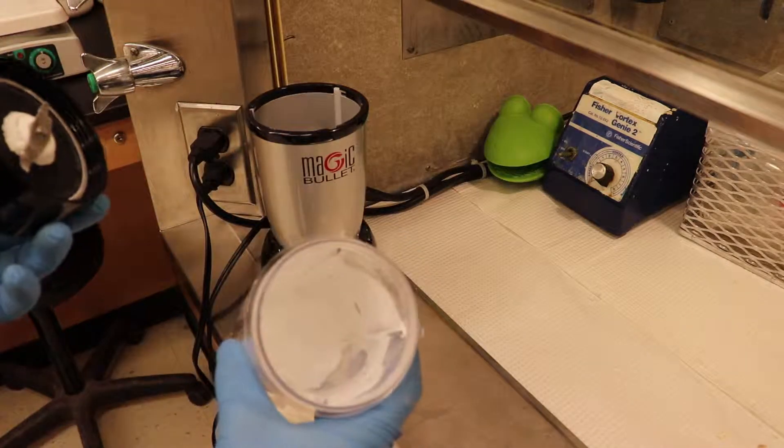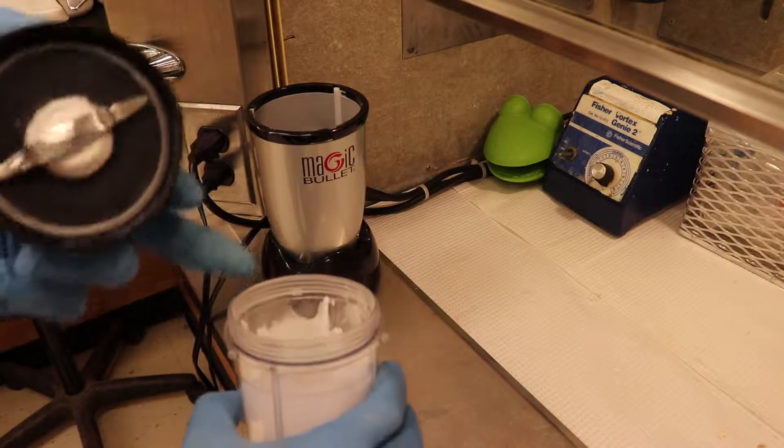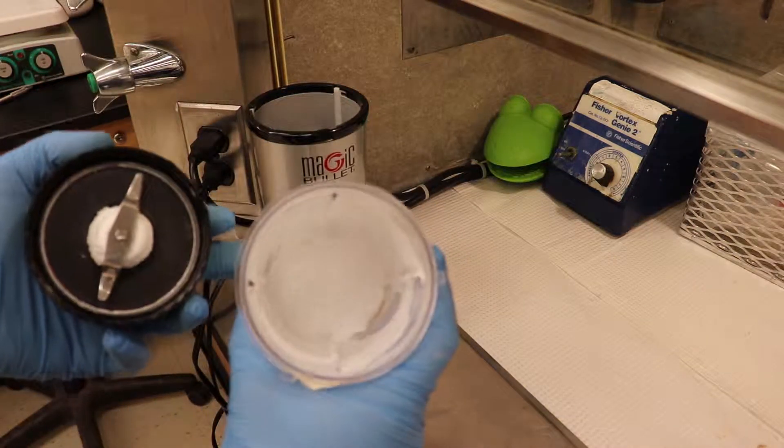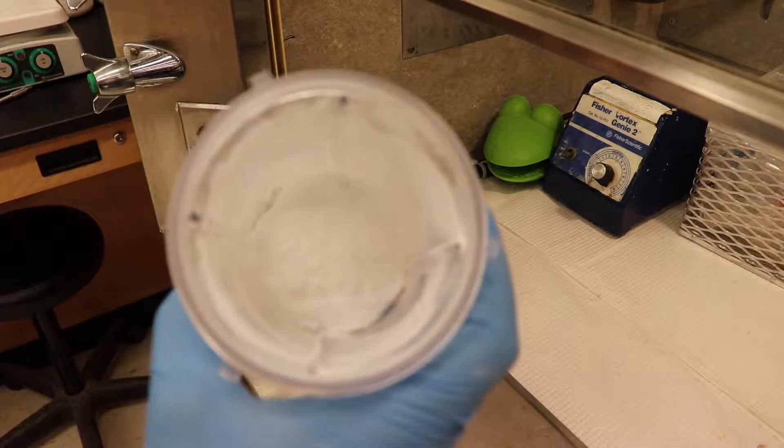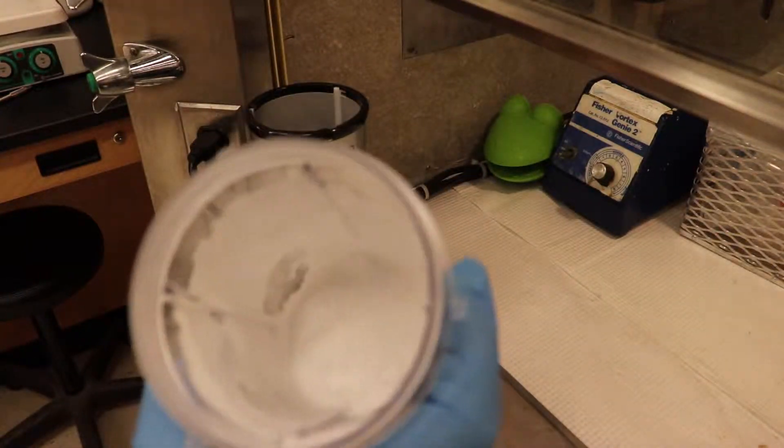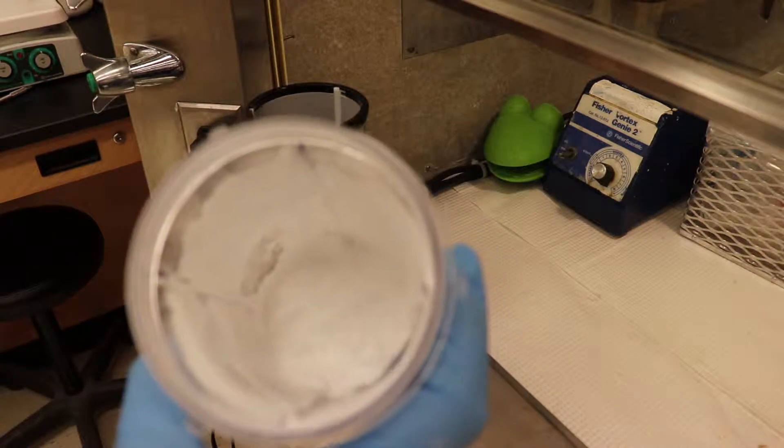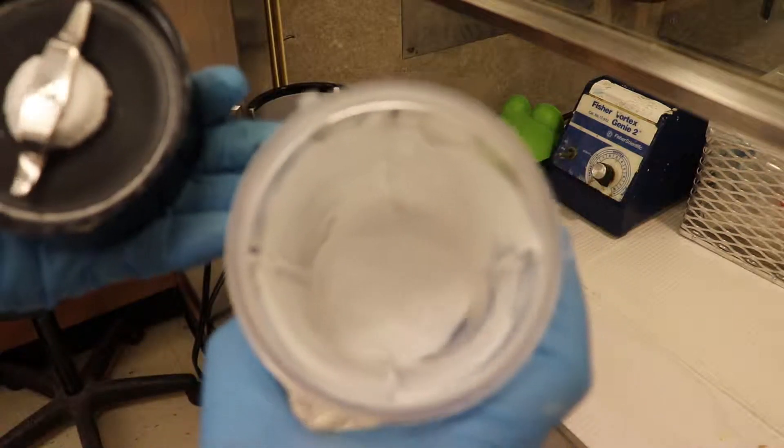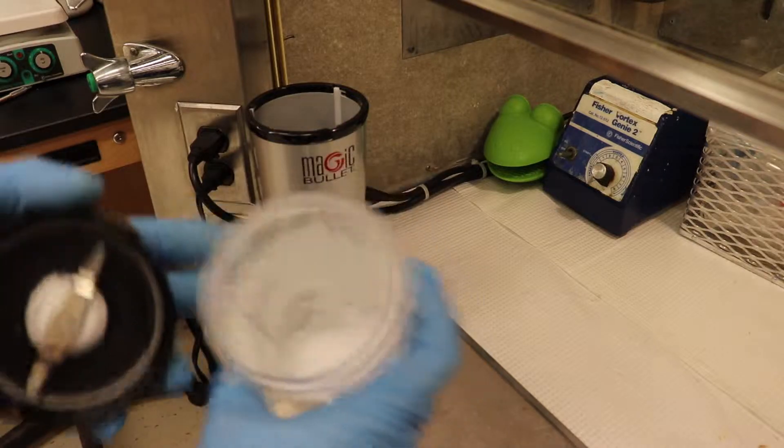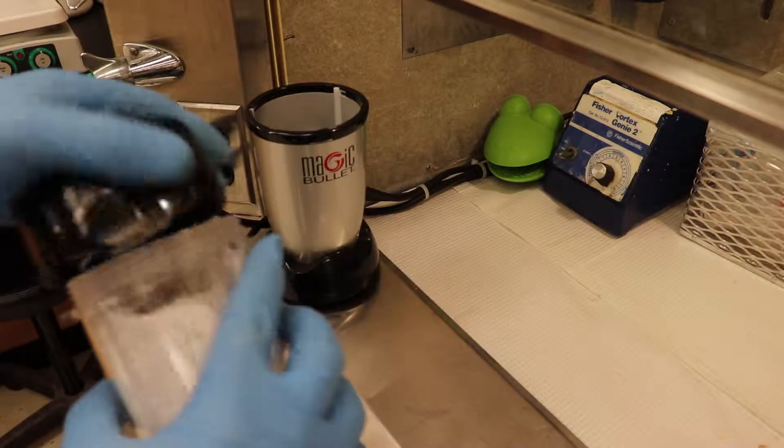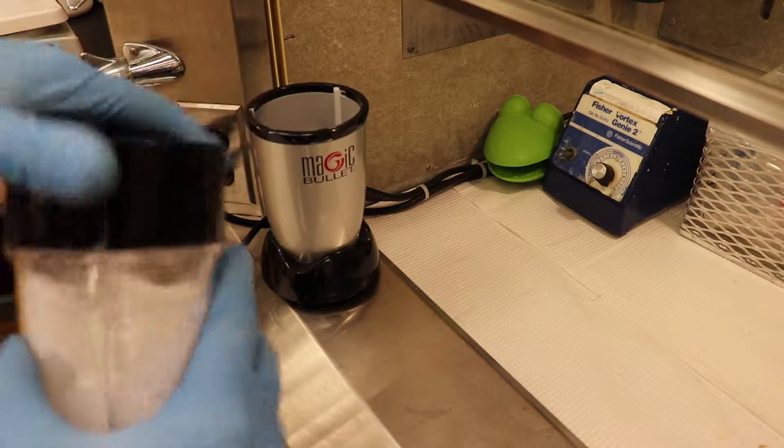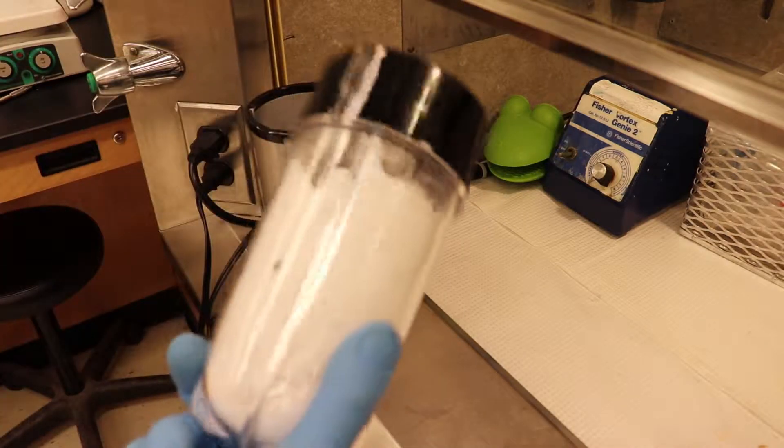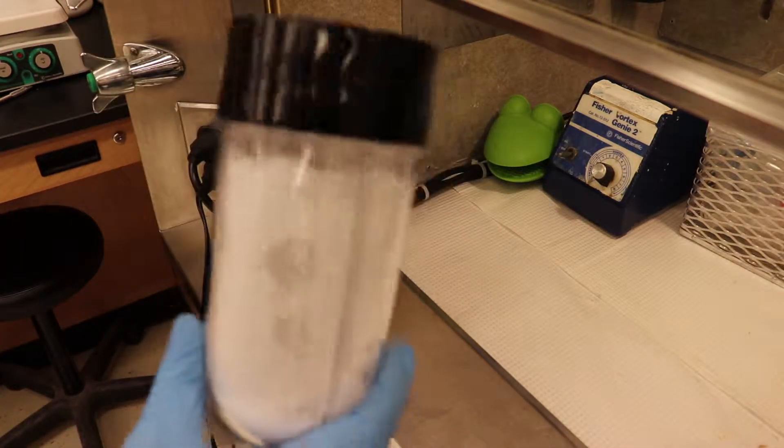This is just the salt, remember? So you can see the extremely fine particles of salt rising up, but as you can see now, hopefully the new camera will focus for me. Come on, Betsy. Well, you're gonna have to take my word for it, but right now, the salt is I would say the consistency of powdered sugar or icing sugar that you'd get from the grocery store, and that's exactly what we want to mix with the other ingredients. I'm gonna give it another couple of bursts, and then we'll go on to the next steps.